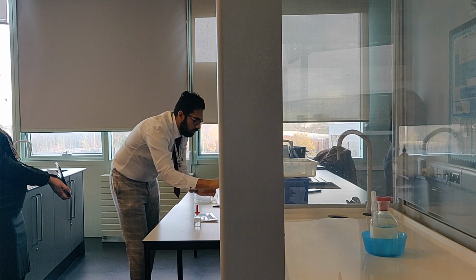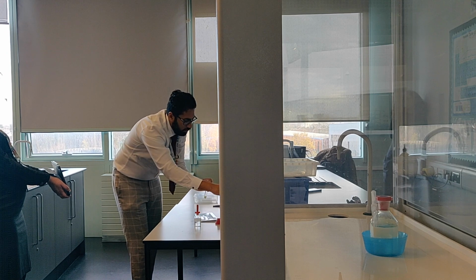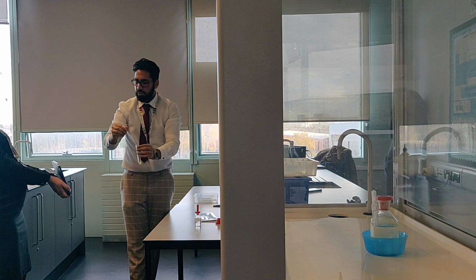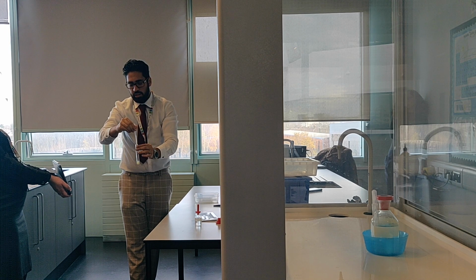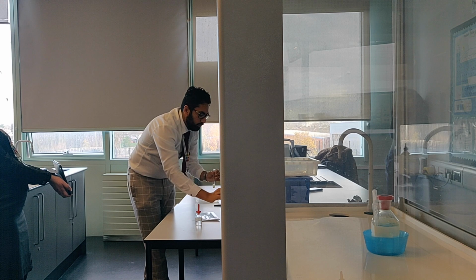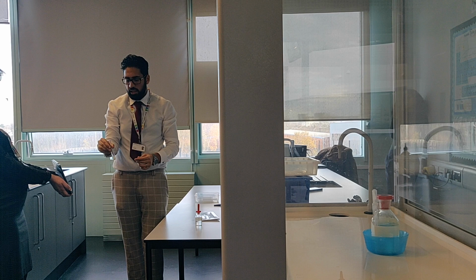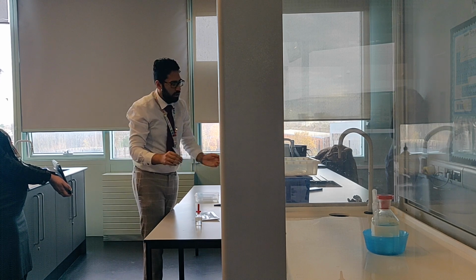Here this is dilute ammonia. Okay, I'm doing it again, well it tends to be an excess. Okay, so that's gone yellow. You see that that's been produced. Right, we're going to get rid of this one and then do the same thing with iodide and concentrated ammonia.